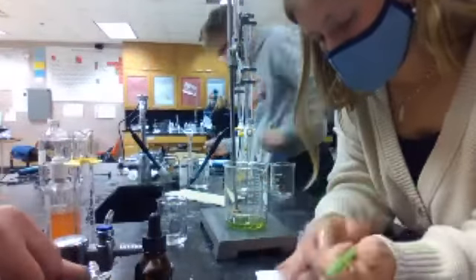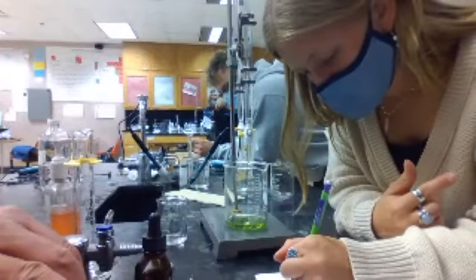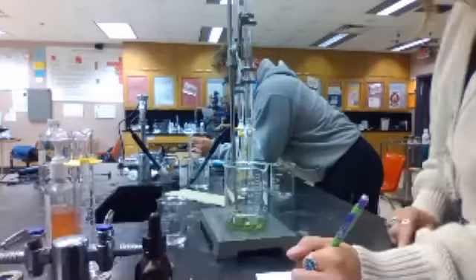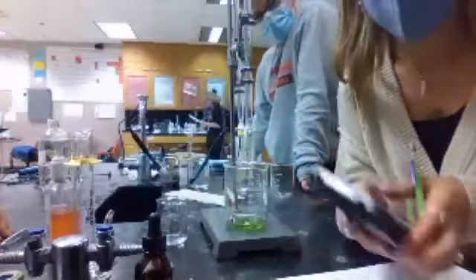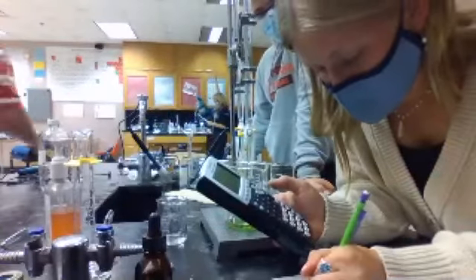So we found out that their math is incorrect. It may be a problem with our pH meter, right? Yeah. So we do 9.99 minus 0.19. Get rid of the 7.84. That 7.84 is an imaginary number that they got with math, so I'm just gonna write that. Okay, this is all for experimental stuff. That was to give you an idea of about how much it would take. About 8. Well, we know it's going to be a little more than that, right? So 9.99.